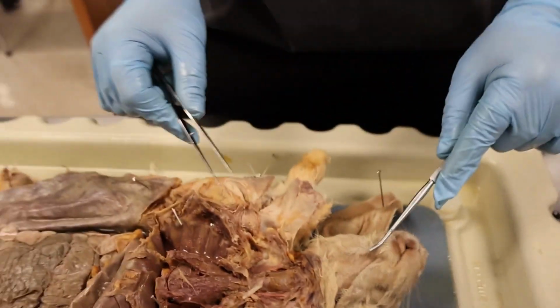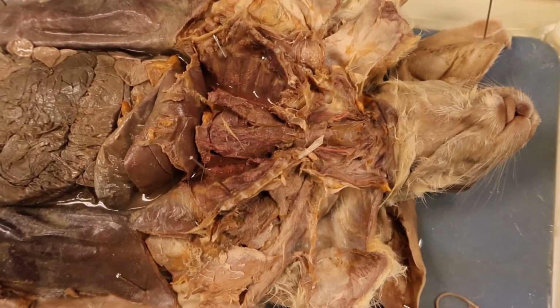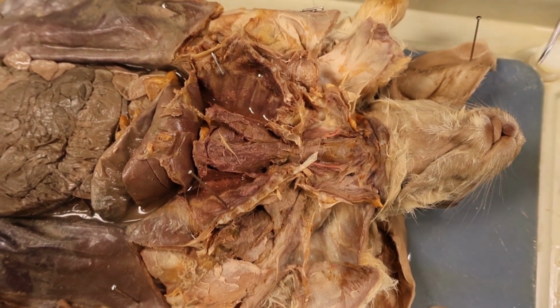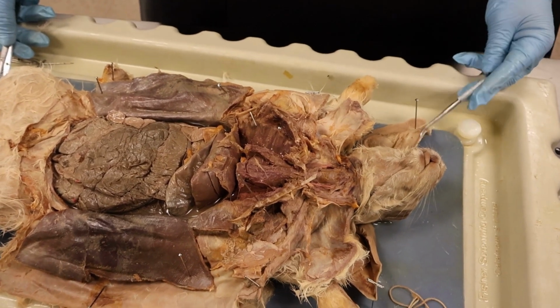And then to touch more on the lungs. The lungs are where the diffusion of carbon dioxide and oxygen happens. All of this exchange happens through the capillaries, and the gas exchange actually happens in the alveoli.